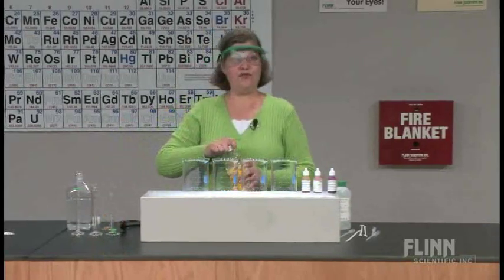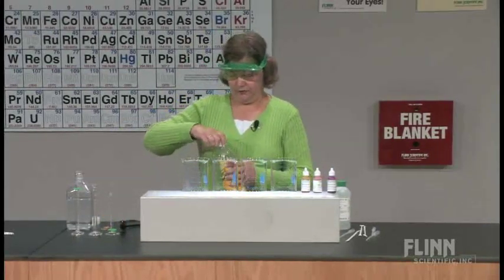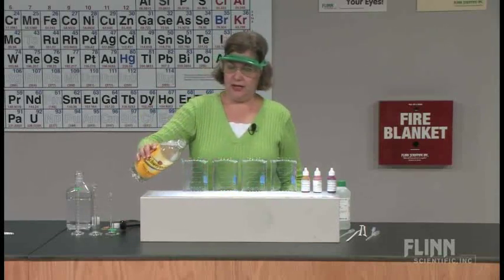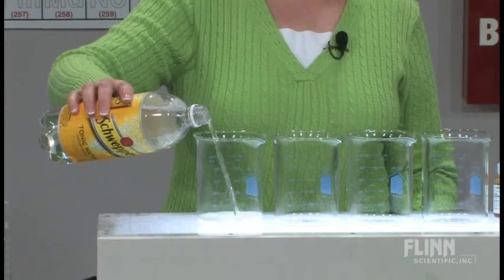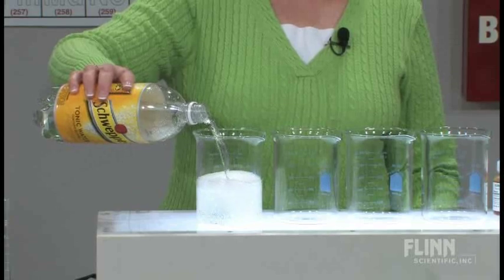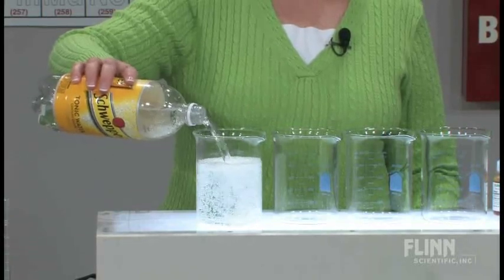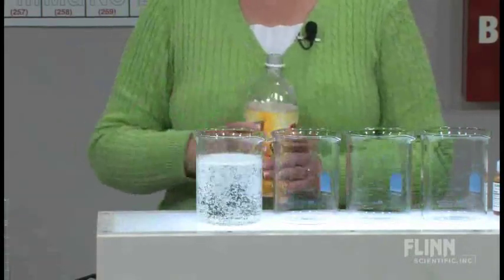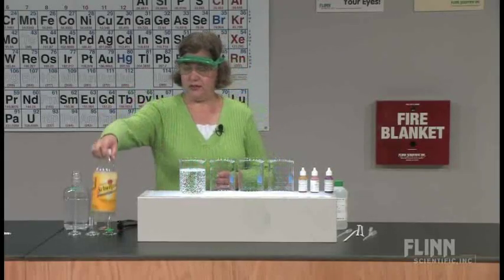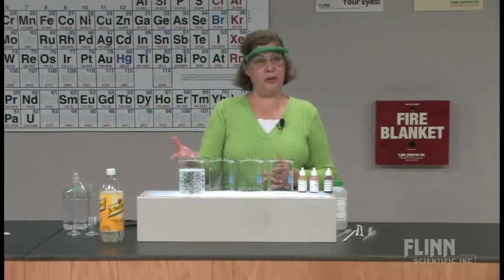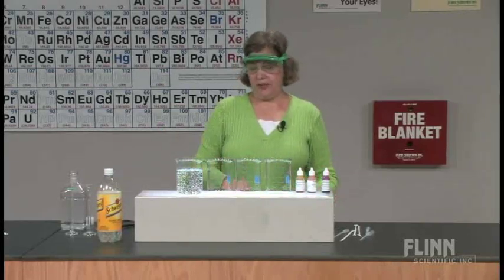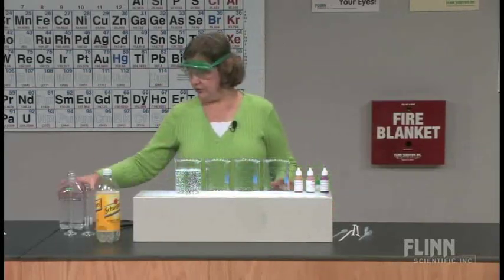We're going to look at substances that are fluorescent and then talk about fluorescence. I'm going to use four solutions. The first one is simply tonic water. Tonic water contains a naturally occurring organic compound that is extracted and isolated from cinchona bark, called quinine. Quinine was the first and most effective anti-malarial agent isolated and produced, and is still used in that capacity.